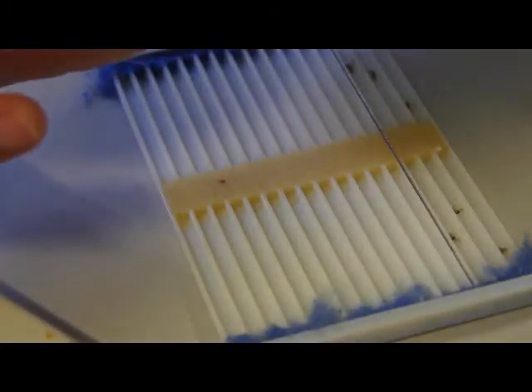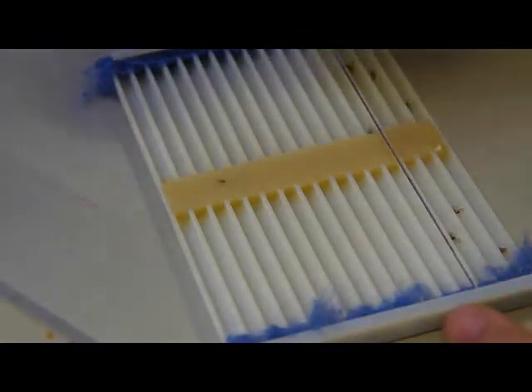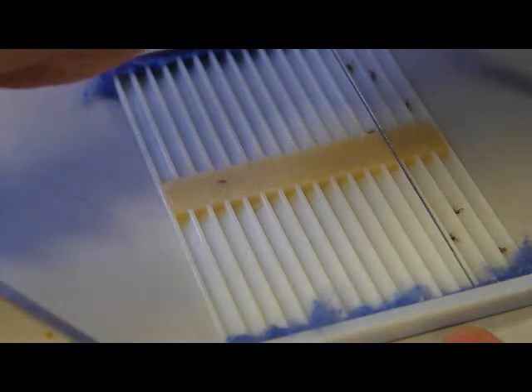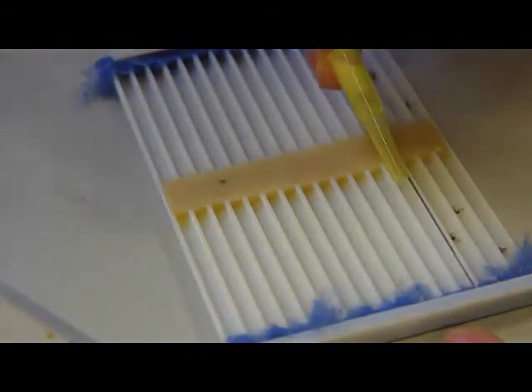If you prefer to use anesthesia instead, the procedure is even simpler. Transfer the flies from the CO2 pad to the arena using your sucker, and slide the cover as you go.